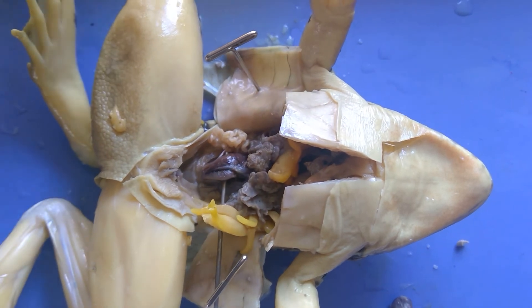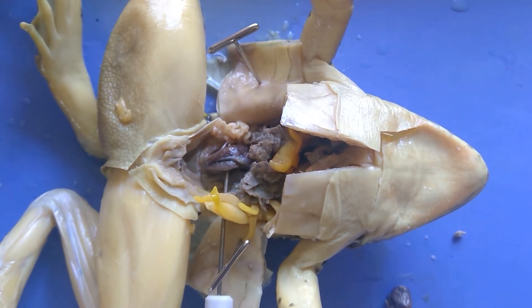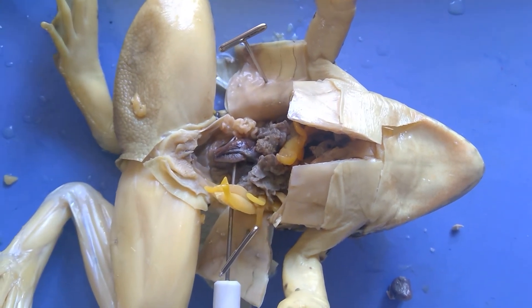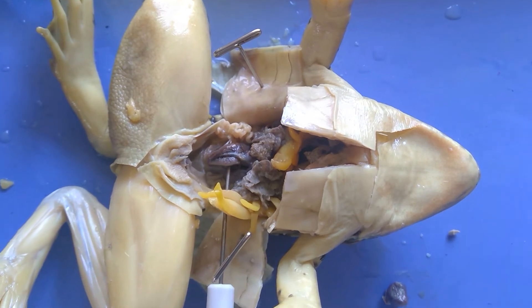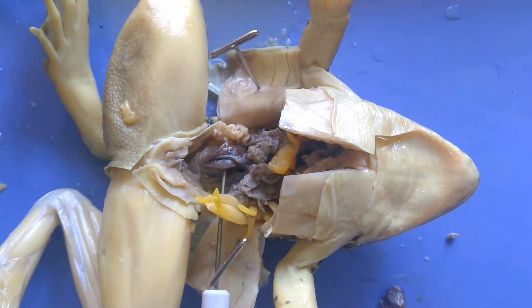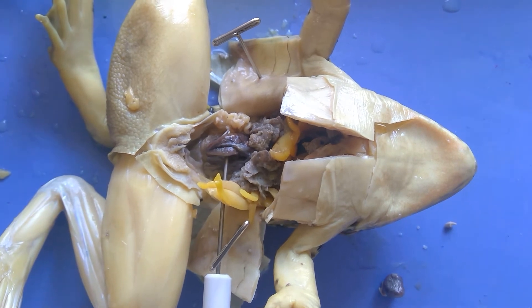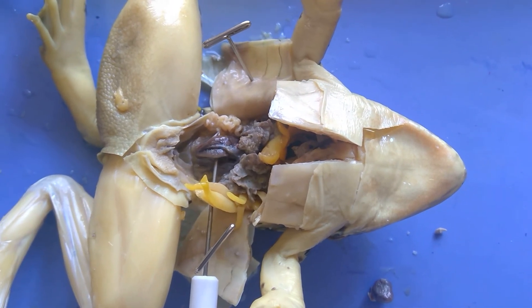As part of the urogenital system, the frog doesn't have a urethra, doesn't have a vagina, and doesn't have a rectum — everything goes out the same opening called the cloaca.